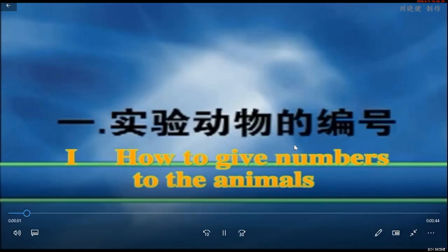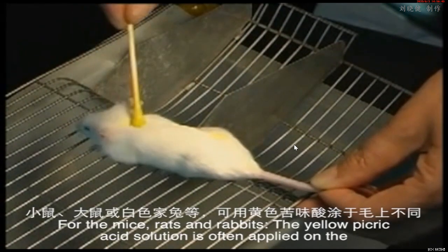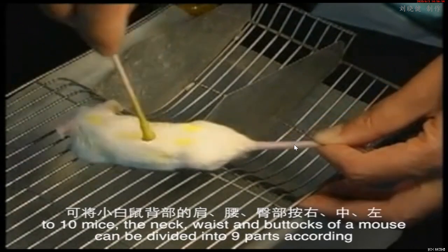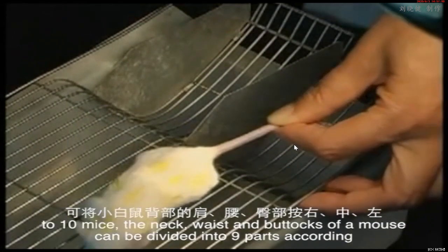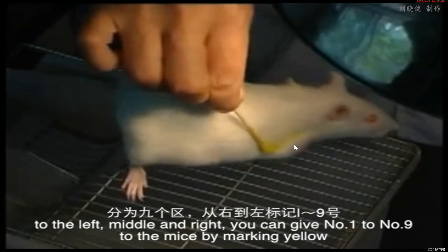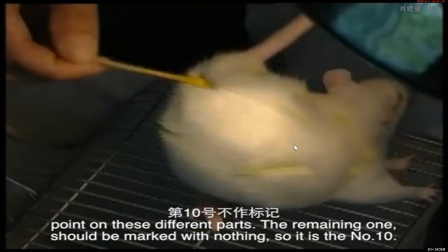How to give numbers to the animals. For the mice, rats, and rabbits, the yellow picric acid solution is often applied on the different parts of the animal's body to give them numbers. For example, to give numbers to 10 mice, the neck, waist, and buttocks of a mouse can be divided into 9 parts according to the left, middle, and right. You can give number 1 to number 9 to the mice by marking a yellow point on these different parts. The remaining one should be marked with nothing, so it's the number 10.